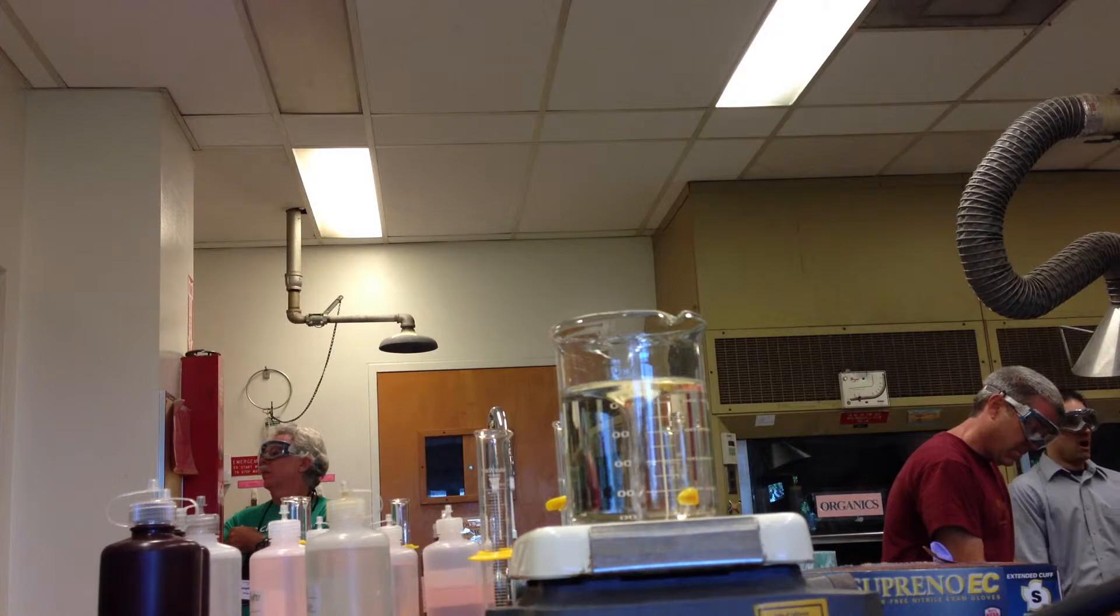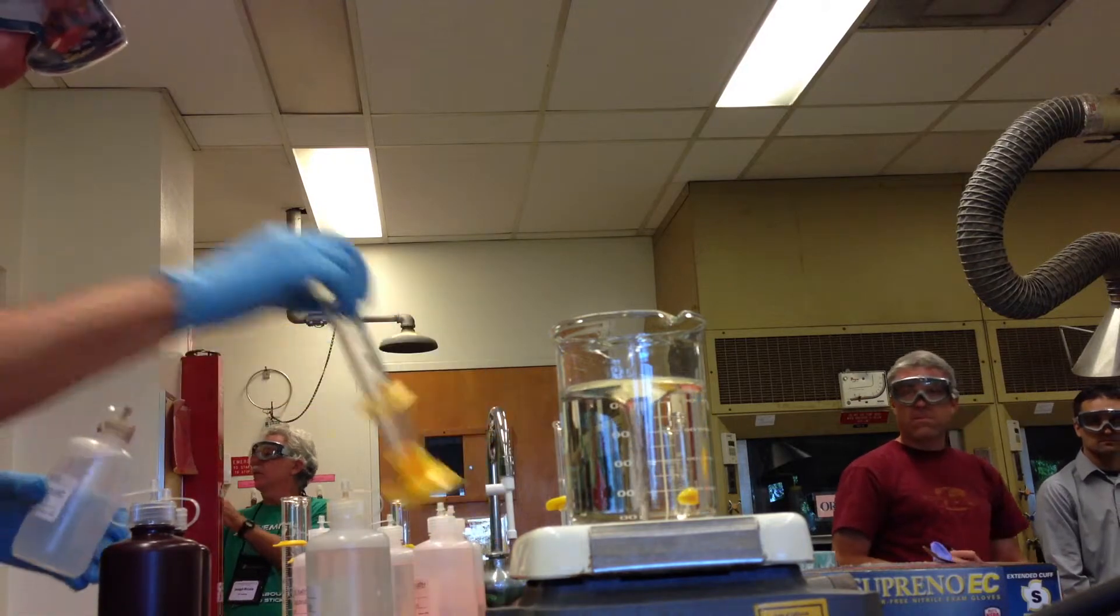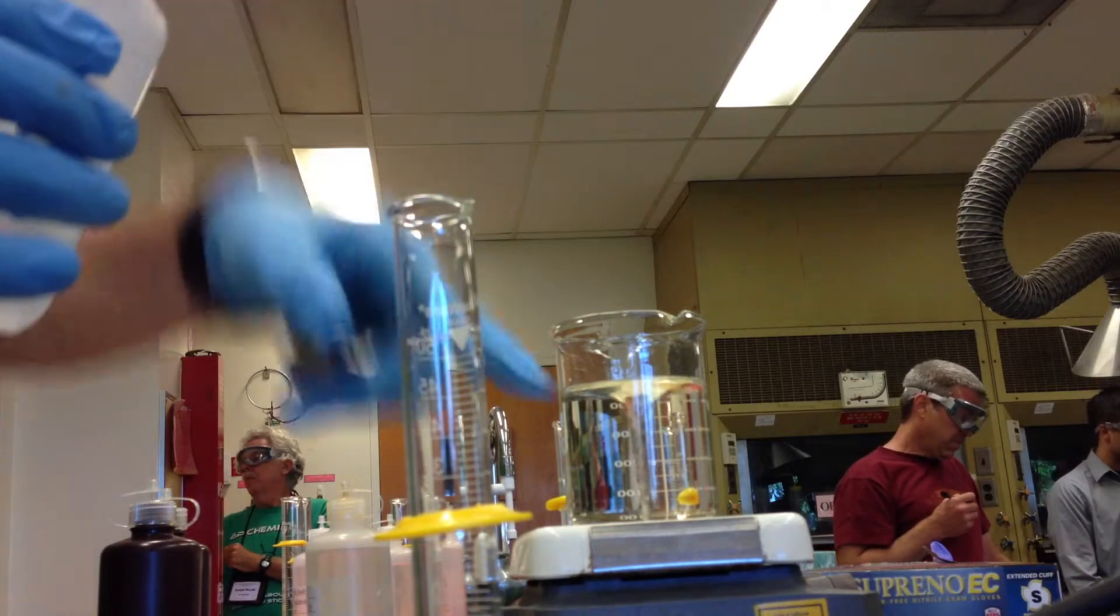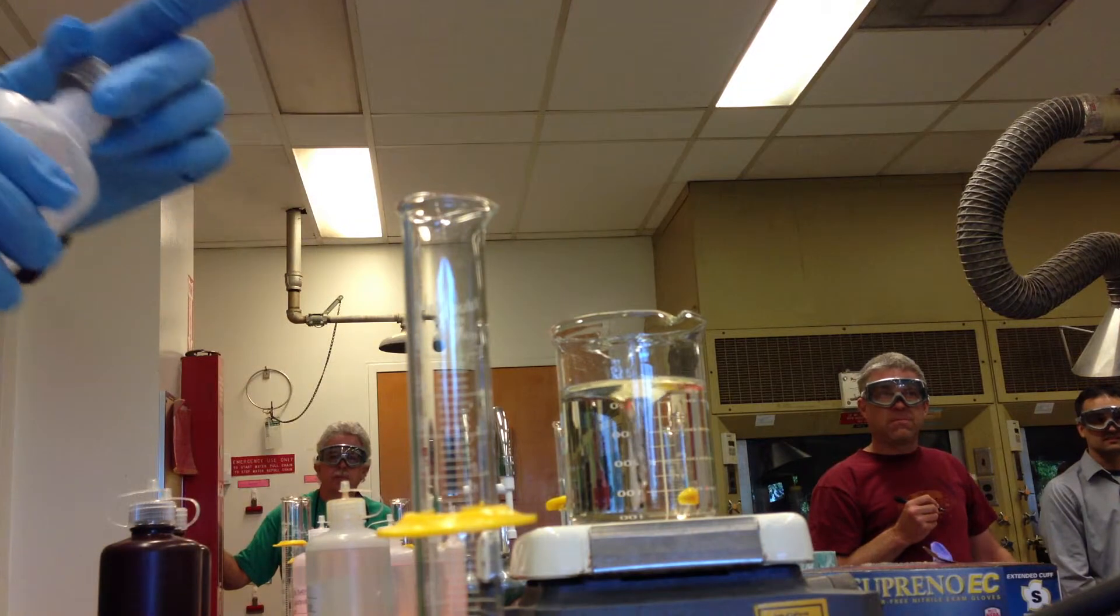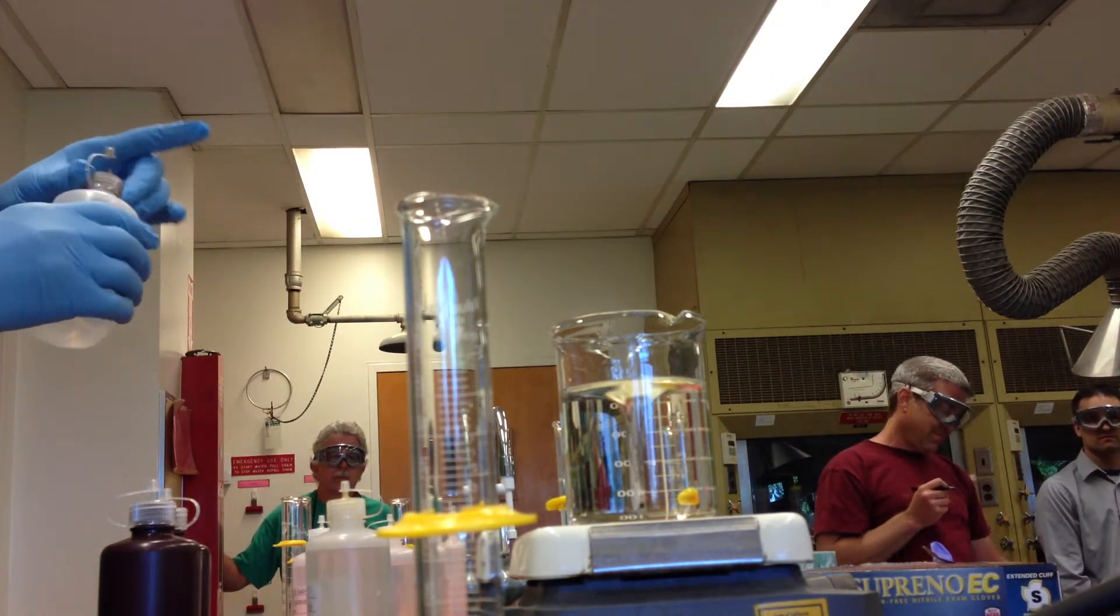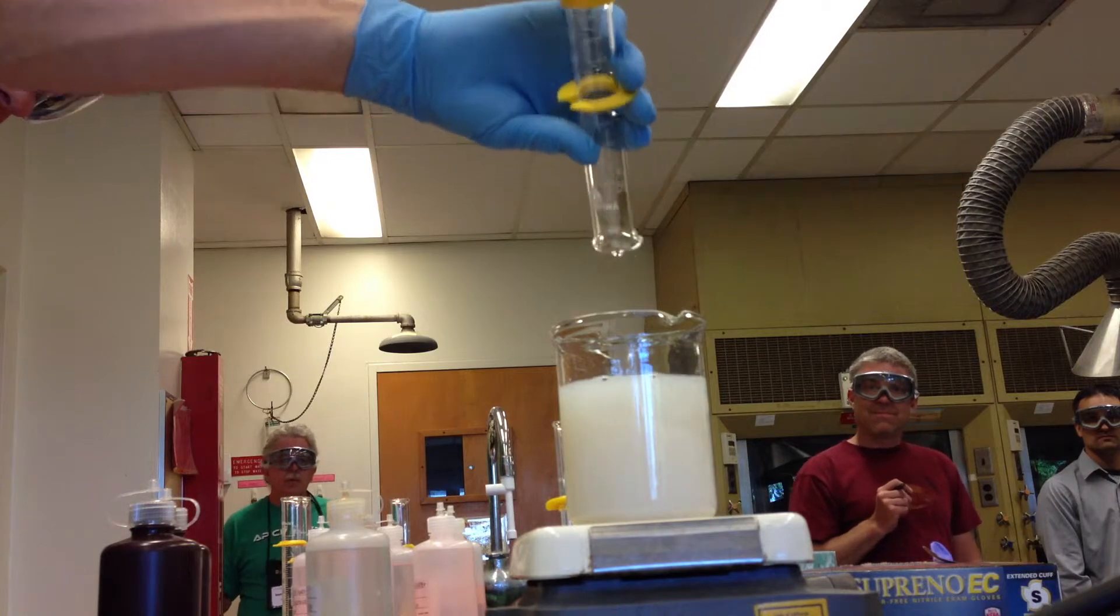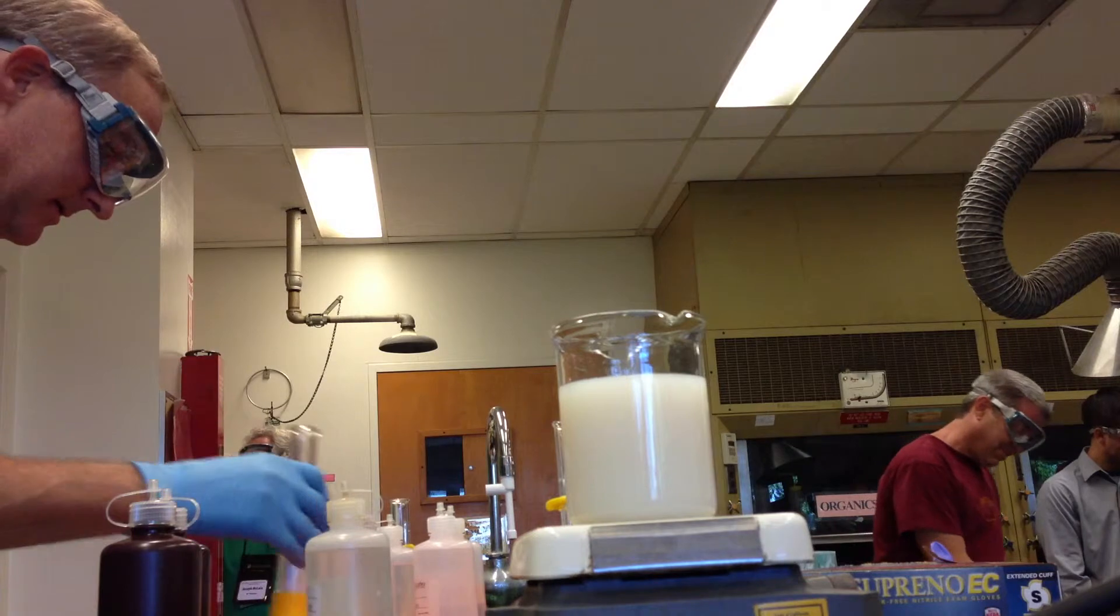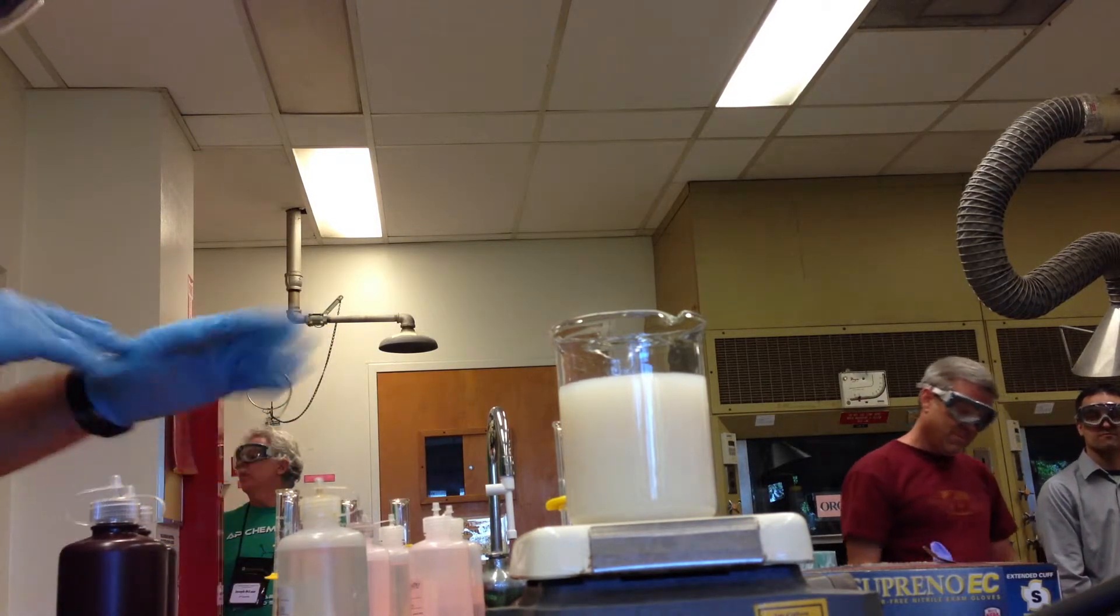Sodium bromide. Silver bromide. 10 milliliters of sodium bromide. Color? Yellowish. We have a vote for yellowish. Oh, it's a cream. Cream colored yellowish. Yellowish. Not white. Cream colored. It's got a little bit of tint there. It's not white the way the silver chloride was white, but it's in the same family.